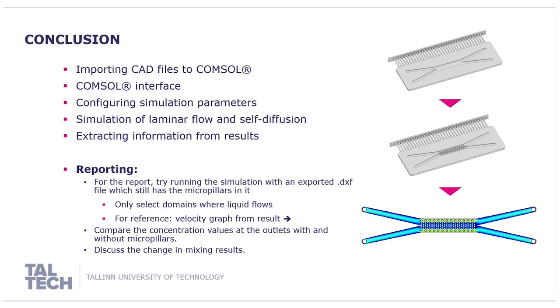how to import it into COMSOL. We walked through the layout of COMSOL and components and physics. We went through configuring variables, probes, and many other simulation parameters to simulate the laminar flow and the self-diffusion between specified concentrations. And we went through how and what can be extracted from the results.